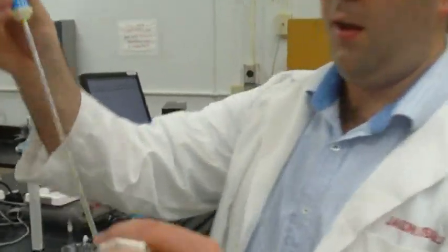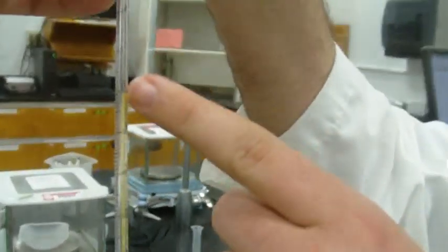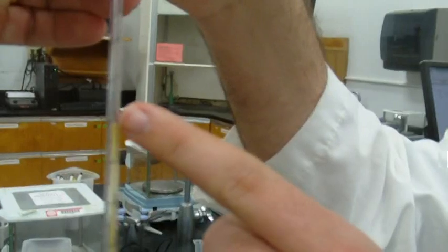So on the pipette, you will notice that the numbers go from 0.9 all the way to 0. Go to 0 to measure out 1 milliliter. And then on the other side, no, not on this one. Excellent. Perfect.